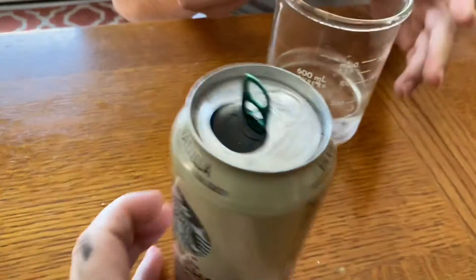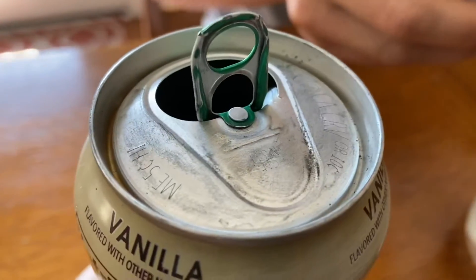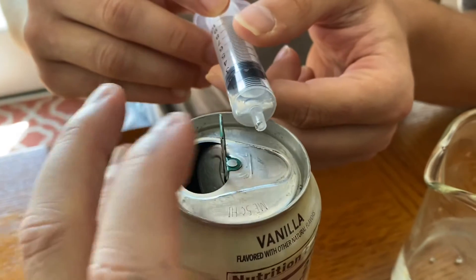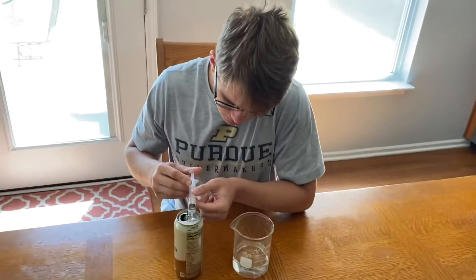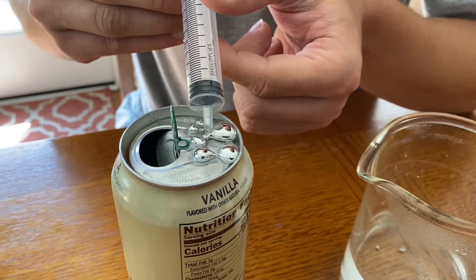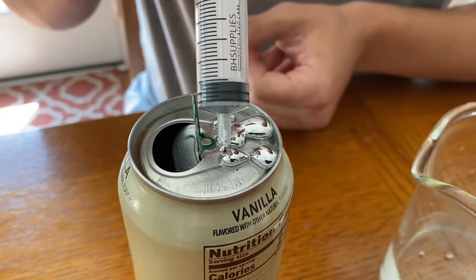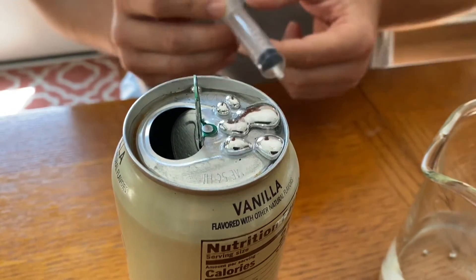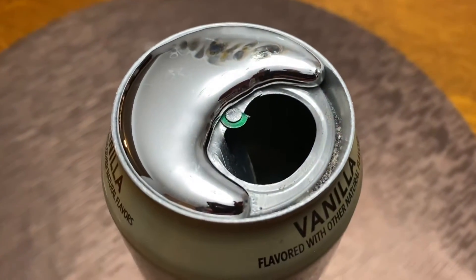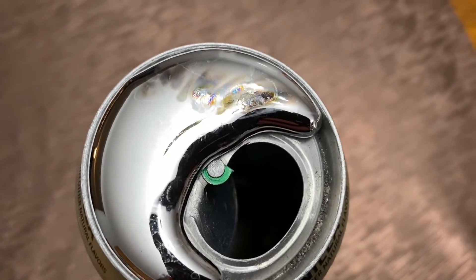You can see the part of the aluminum can that we roughed up — we got rid of that oxide layer. He's going to put the gallium right on the lid of the can. You can see right now it's very firm to the touch; that's going to change after a bit. Just coat the lid with that gallium. Then you're going to let this set for about an hour and let that gallium alloy with the aluminum. Right away as the gallium starts to alloy with the aluminum, you can actually see impurities rising to the surface. Over here you have your pure gallium, and over here you can start seeing the aluminum impurities rising to the surface. This is evidence that it is definitely alloying to the aluminum.